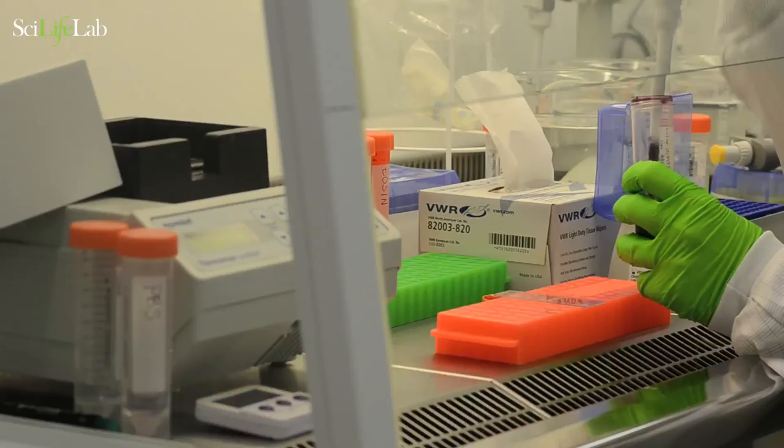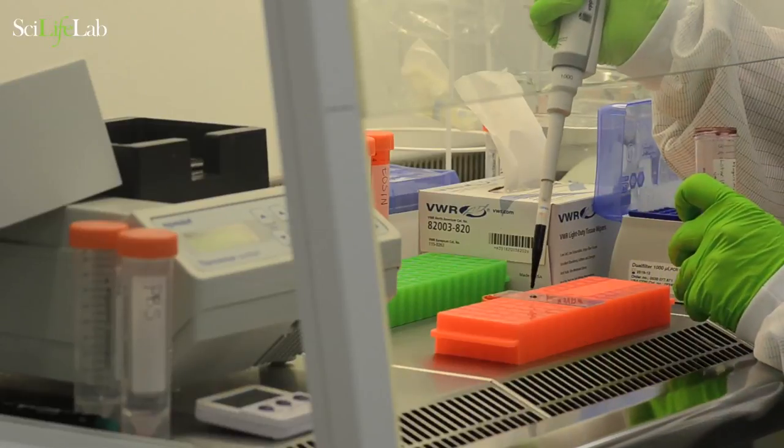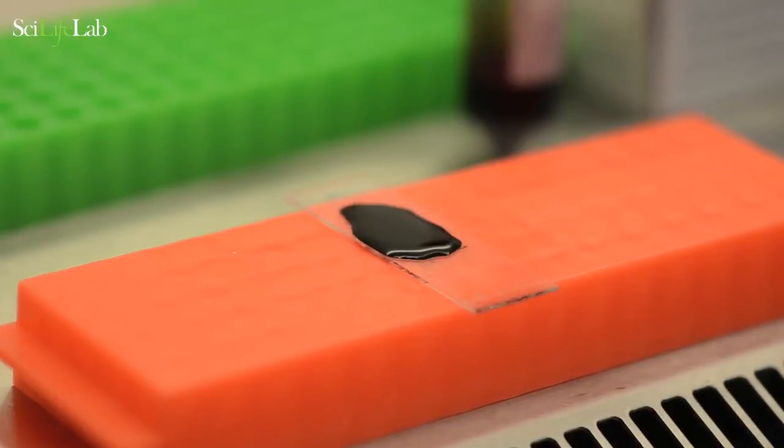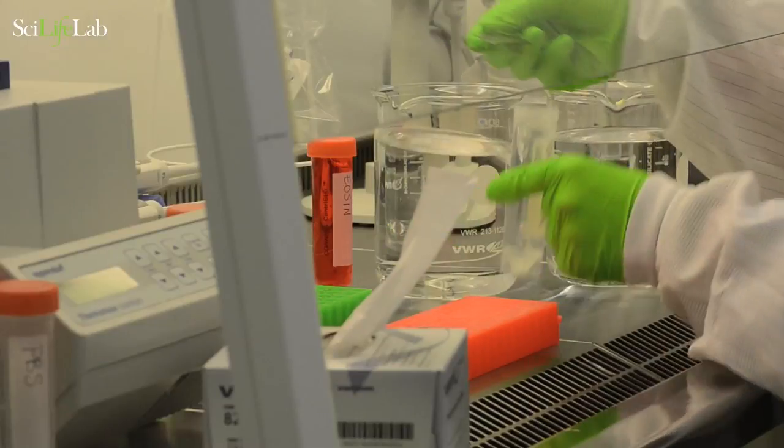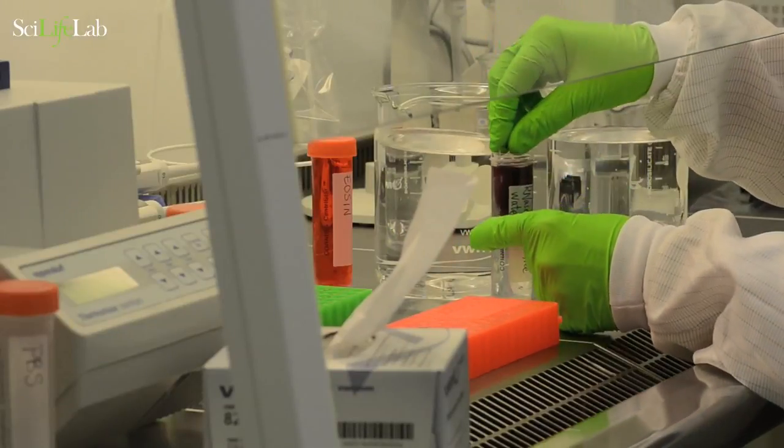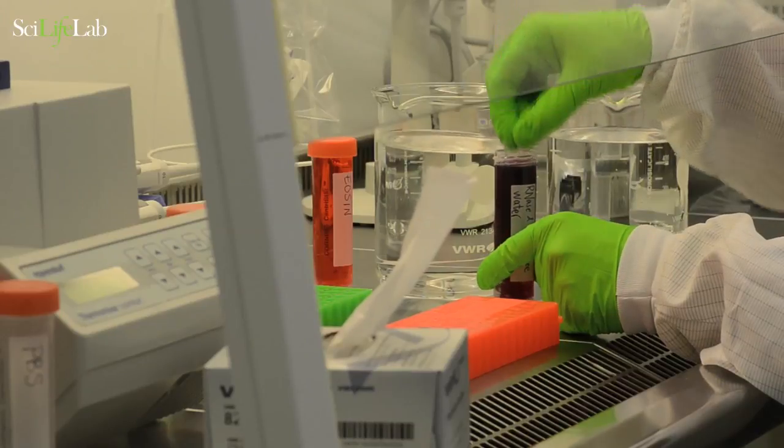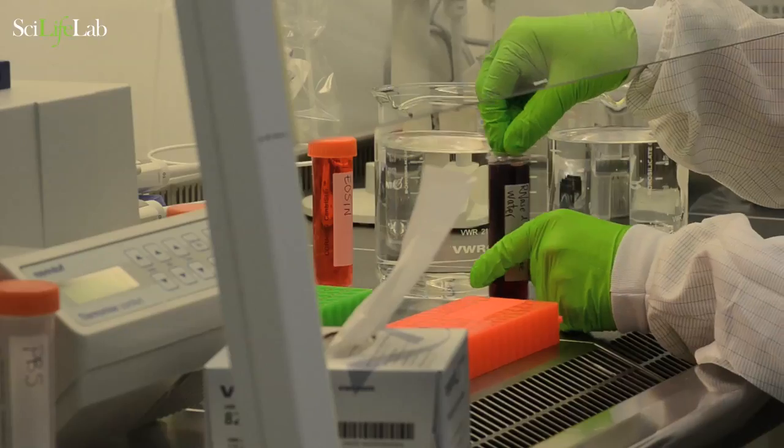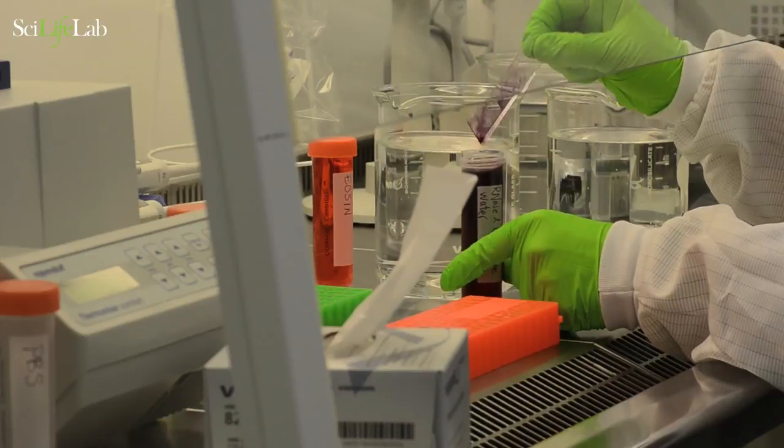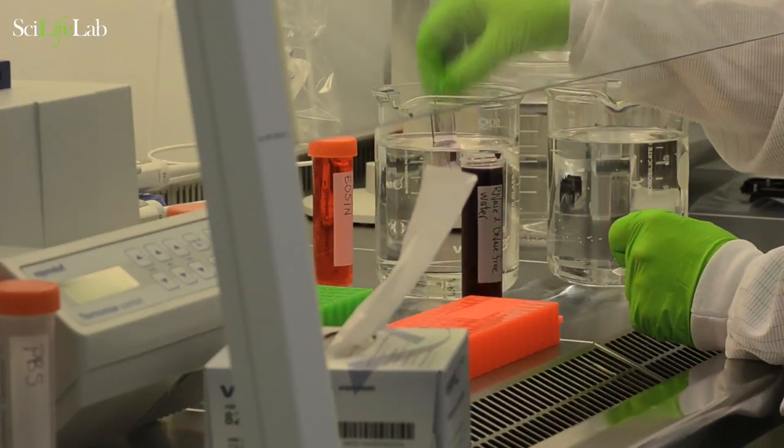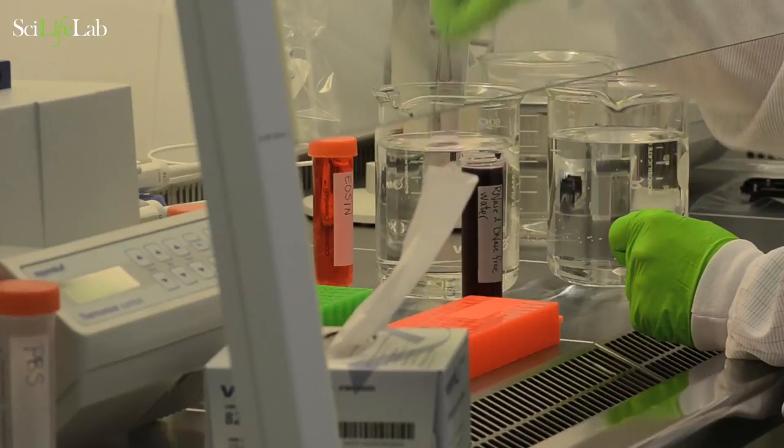Add hematoxylin covering all of the tissue sections. Incubate for 7 minutes at room temperature. Wash away the hematoxylin by dipping into a series of beakers of clean water. Ensure that the water is DNase and RNase free.